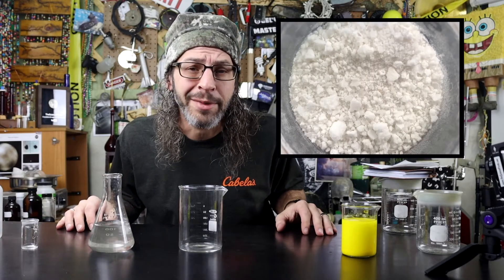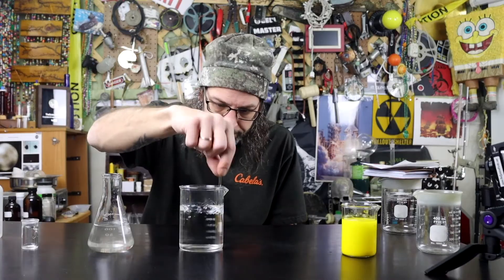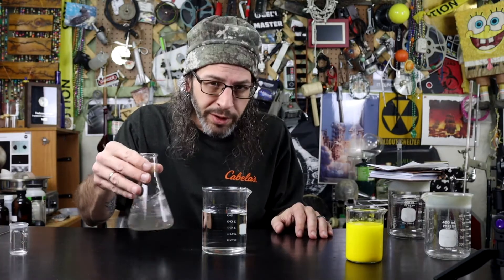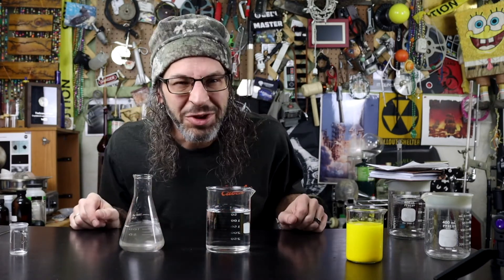The other solution I'm going to use is very common — sodium chloride, the salt that you put on your pizza and french fries. We're going to dissolve some salt in water — that'll be our other solution. Two solutions, both of which are clear and colorless. We started with salt and silver nitrate, dissolved each separately in water. It's important to note that they are complete solutions — there are no leftover salt particles or silver nitrate pieces floating around. They've dissolved completely. We're going to combine these two solutions together and see what happens.